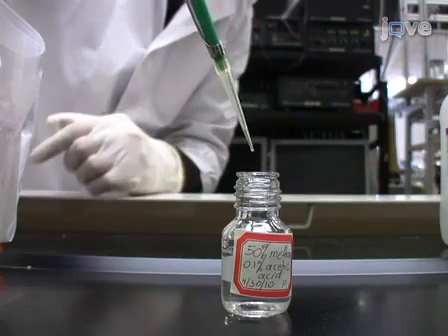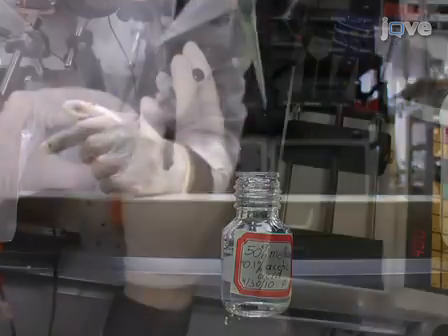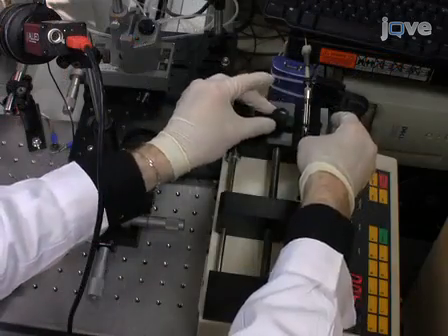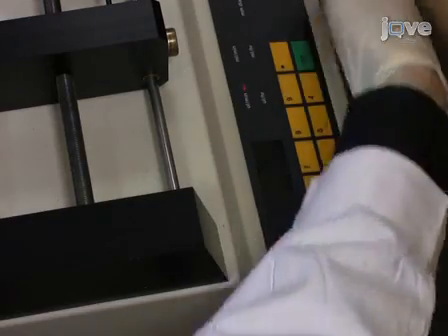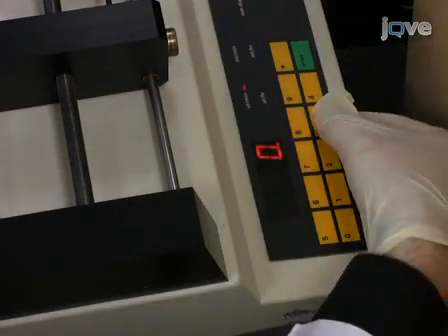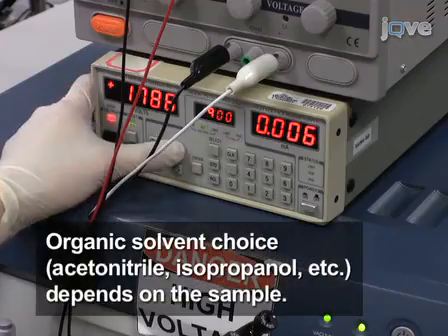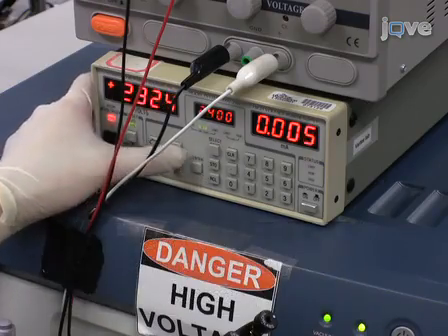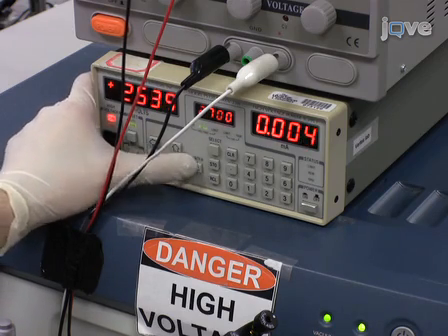For the electrospray, prepare a 50% methanol solution with 0.1% acetic acid for positive ion mode or 0.1% ammonium acetate for negative ion mode. The stability of the electrospray is crucial for successful imaging. Depending on the solvent selection, the flow rate and the spraying voltage need to be adjusted to achieve a stable spray. For reactive LAESI in imaging applications, the electrosprayed solution may contain reactants.